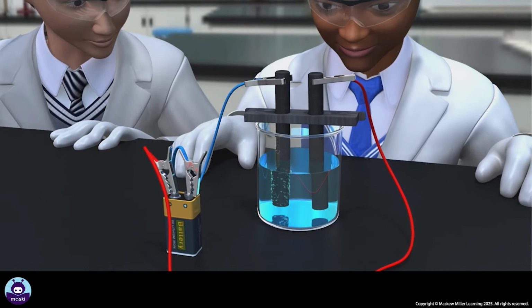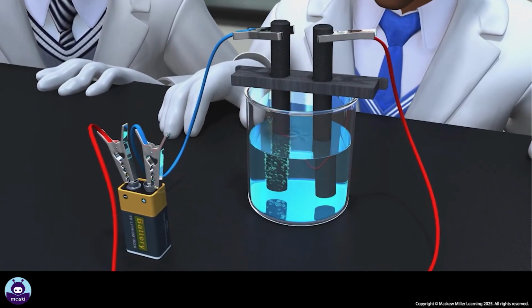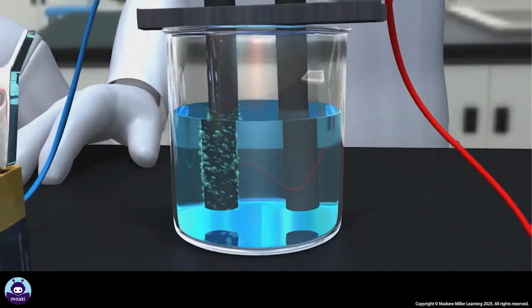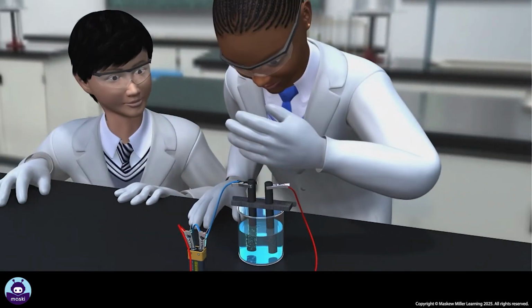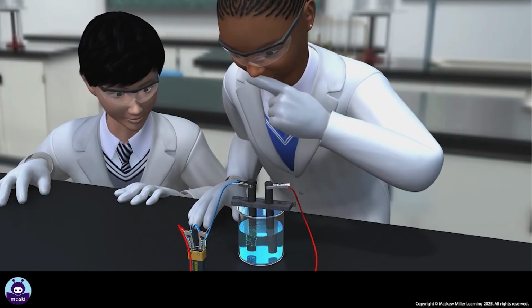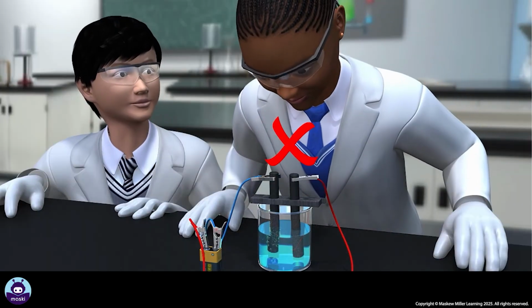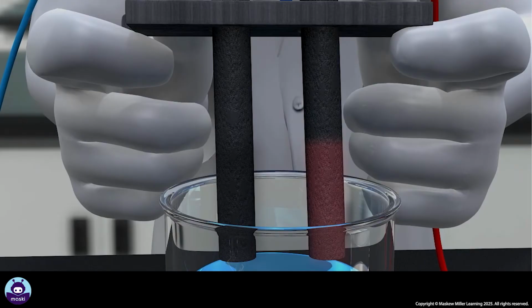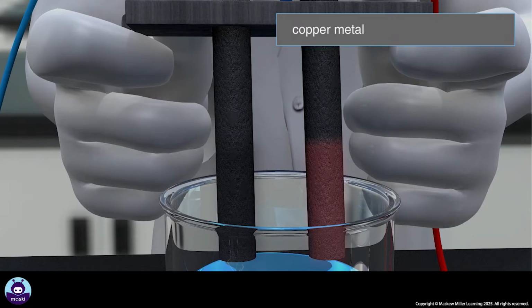After a while, bubbles start forming at the graphite rod that is connected to the positive terminal of the battery. The gas has a sharp, pungent smell. It is chlorine gas. Do not inhale chlorine gas as it is poisonous. A reddish-brown layer coats the lower end of the other rod. The layer is copper. Copper chloride is decomposed into the elements copper and chlorine.